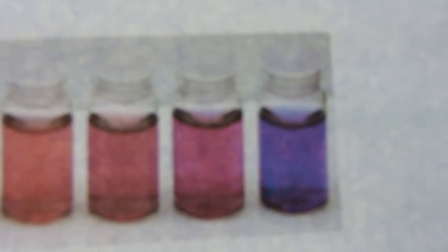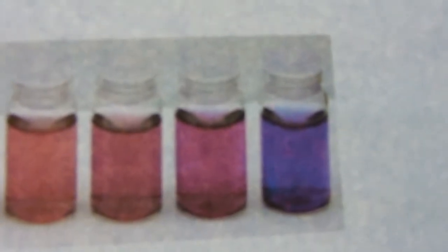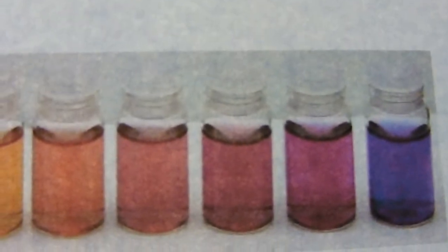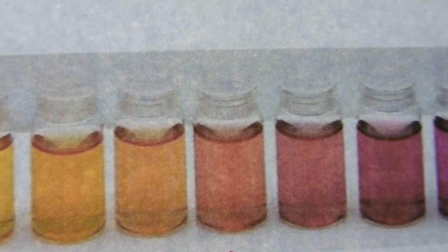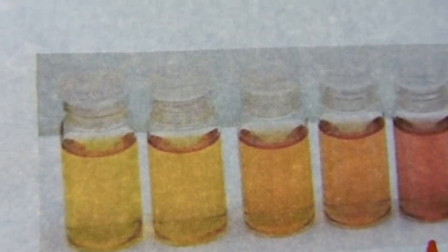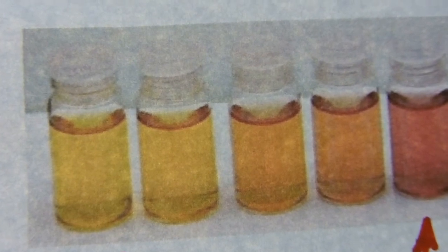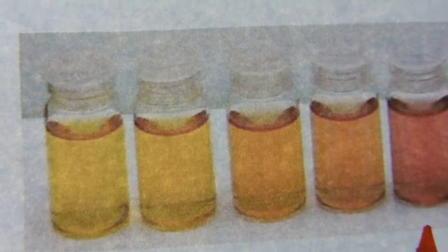We've got purple, which means that the carbon dioxide is being used up and the pH is going higher, and therefore the indicator changes to purple. As the light gets further and further away, we go through those shades of orange and into the yellow, where the furthest one away is clearly not getting enough light to photosynthesise and is doing more respiration. It doesn't mean it's doing no photosynthesis — it's just doing more respiration. So the pH has gone down and it's gone yellow.